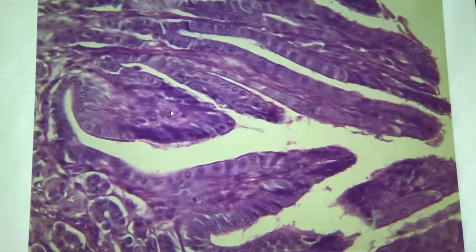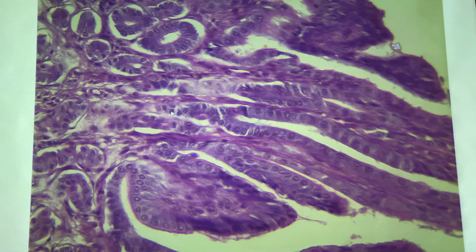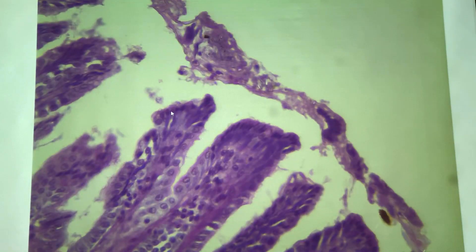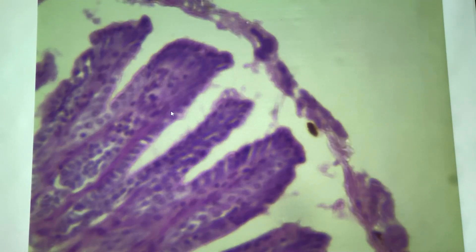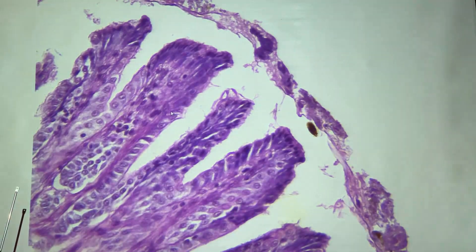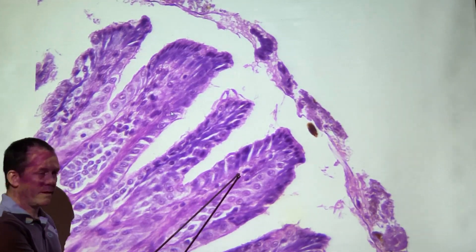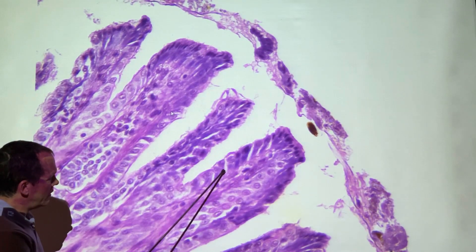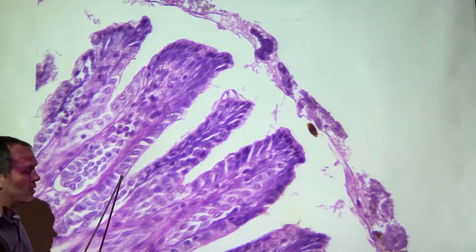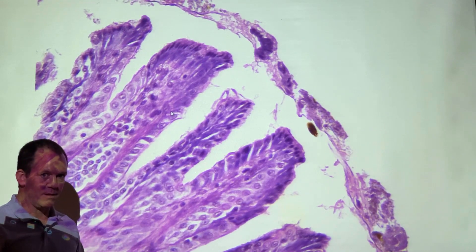The lumen is here. These cells don't really look columnar—they look sort of cuboidal, which is unfortunate for my demonstration, but I assure you they're columnar. The ones down here look more like it. These are the epithelial cells—the columnar cells. They may look squashed and cuboidal here, but in the digestive system we're not going to have any cuboidal cells lining any lumens, so these are columnar epithelium.